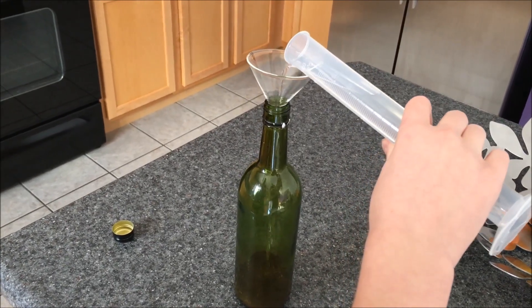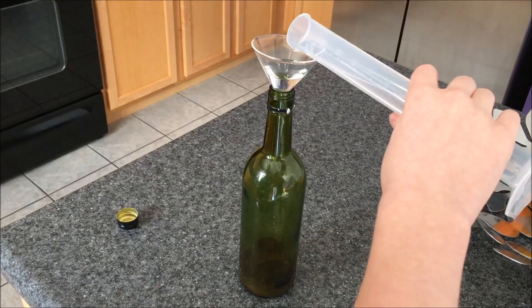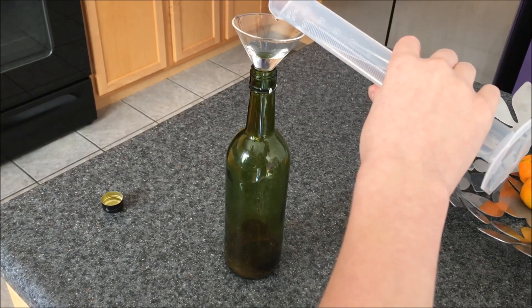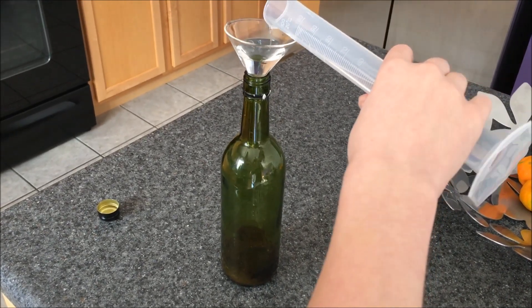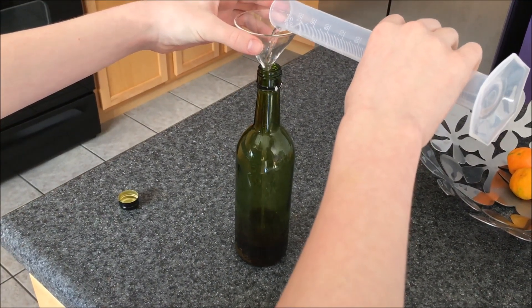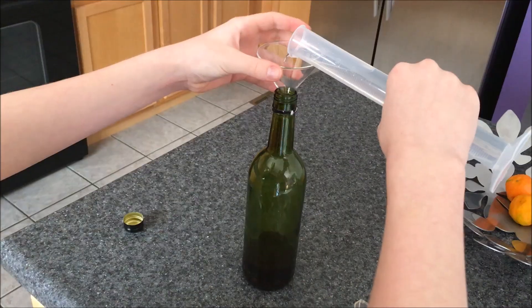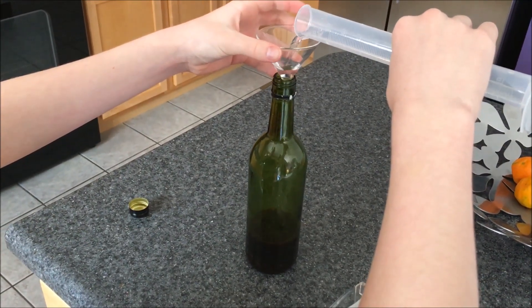For this next step, you will want to add 500 ml of any alcohol for every one pound of peppers you use. I am using ethanol because it isn't very toxic. After your alcohol has been added, seal your container and set it aside for a week. It may help the extraction to shake the container every once in a while.